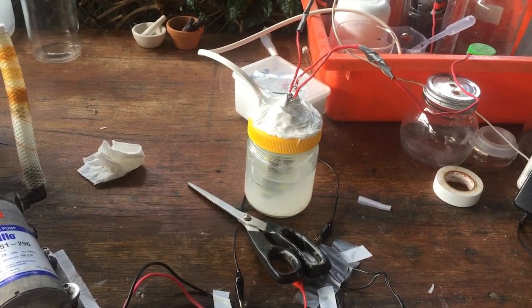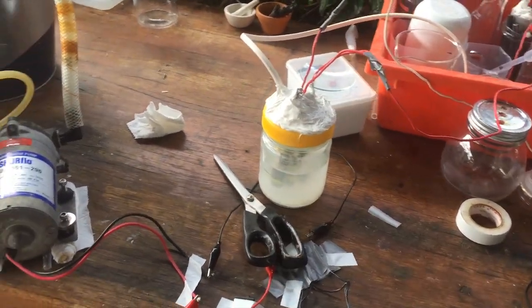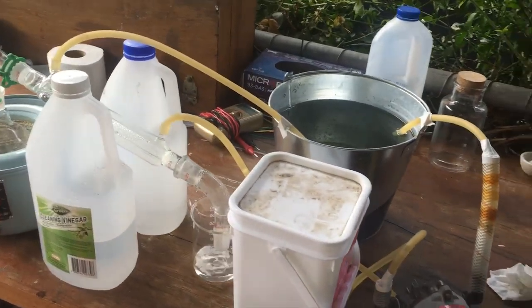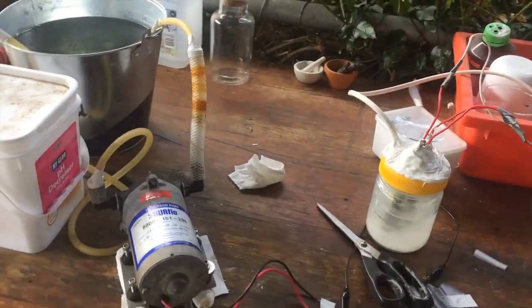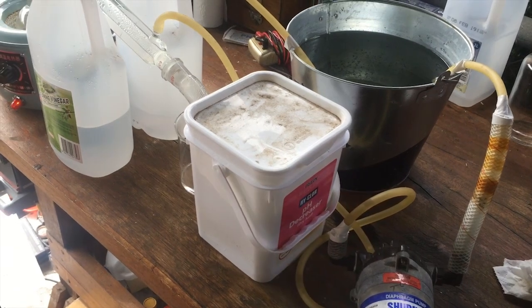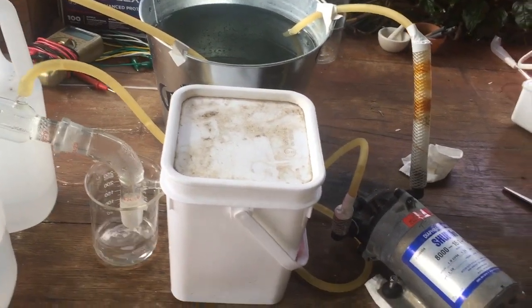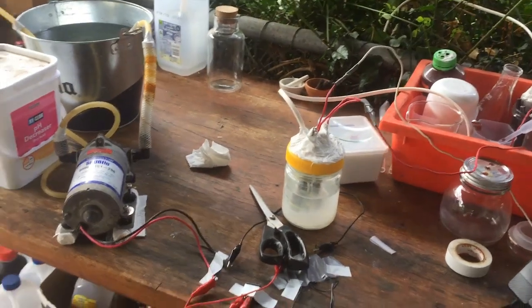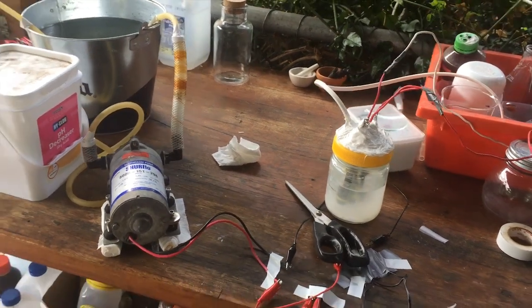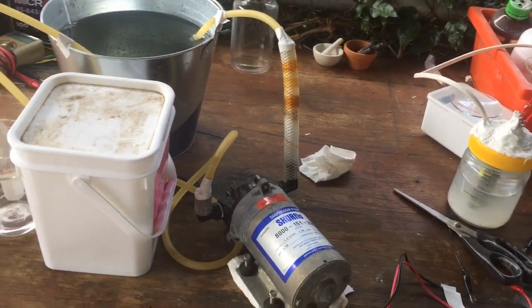So I had to re-distill, and we had problems with that last time because the sodium carbonate wouldn't actually dehydrate in my distillation setup. It was quite tricky because all of the sodium carbonate I'd used as an electrolyte had actually absorbed nearly half of the water we'd collected, which is quite a substantial amount. There was a lot of work to make just this 600 millilitres, so what I ended up doing is I reacted the sodium carbonate with some sodium bisulfate, which turned it into sodium sulfate, which I was then able to dehydrate much easier — apparently the temperature you need to heat sodium carbonate to in order to completely dehydrate it is over 300 degrees, whereas sodium sulfate pretty much dehydrates at the boiling point of water.